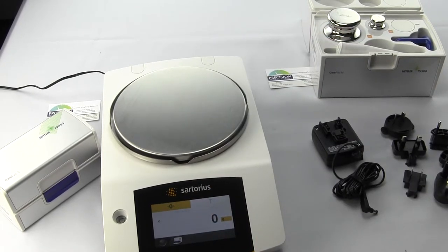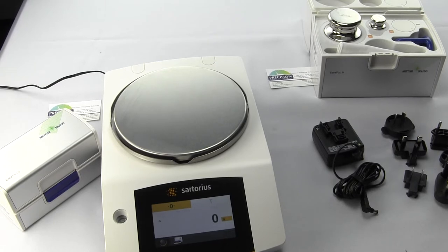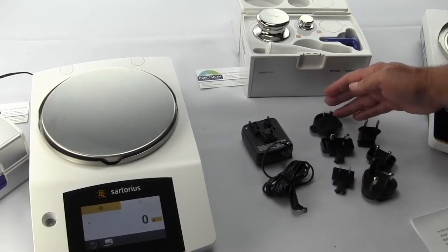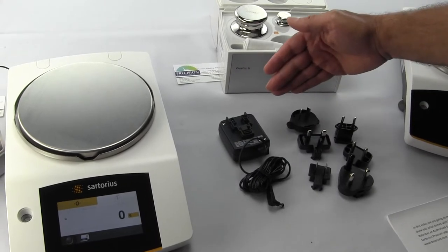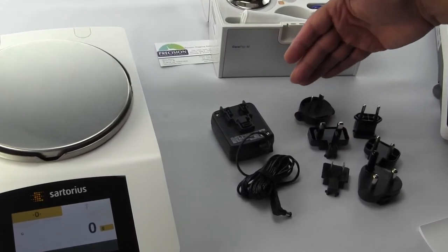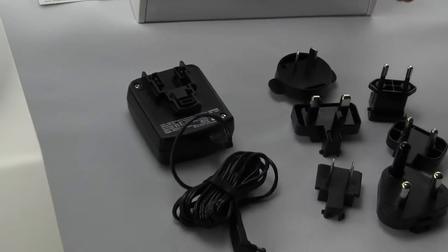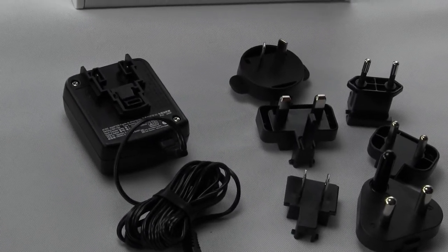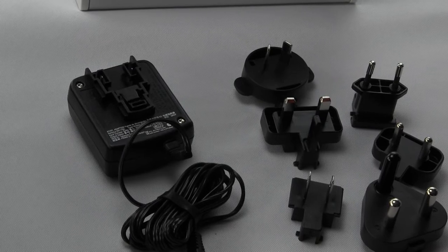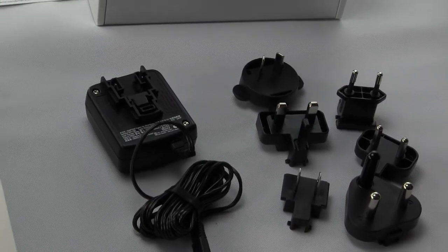The Practum series are powered by AC adapter. When you purchase the balance it comes with this universal DC adapter power kit with multiple plugins for different countries, which we'll discuss in more detail in a minute.